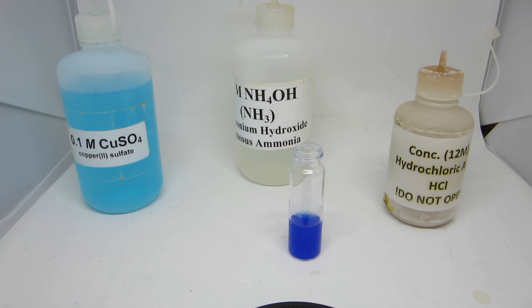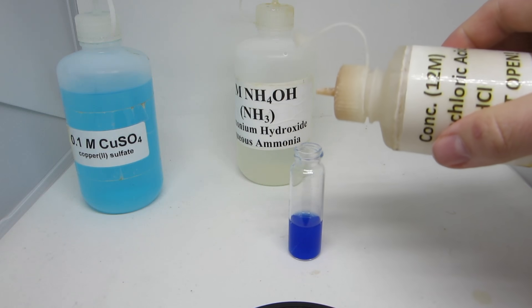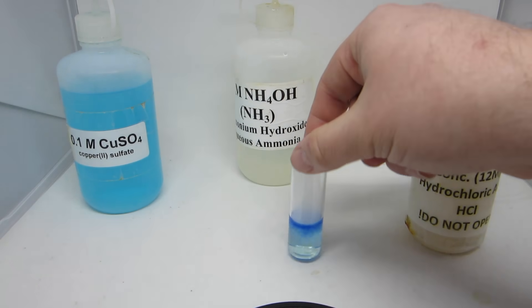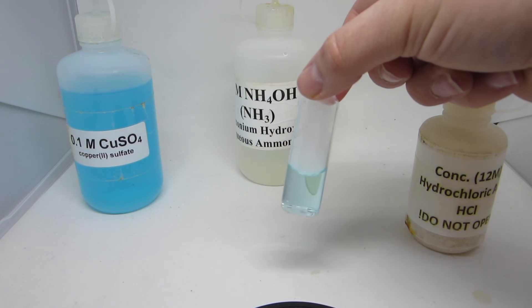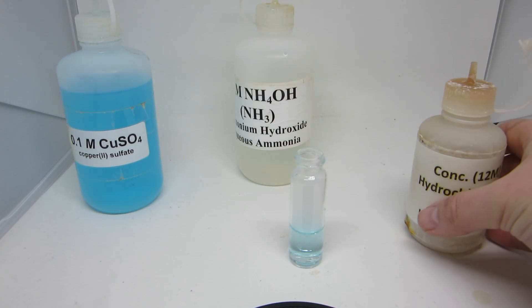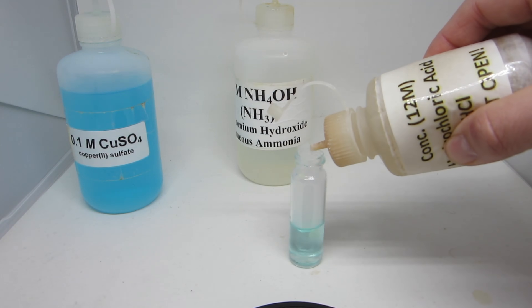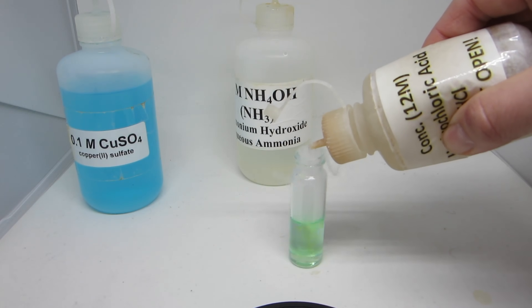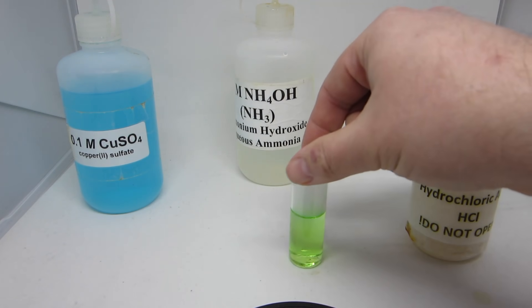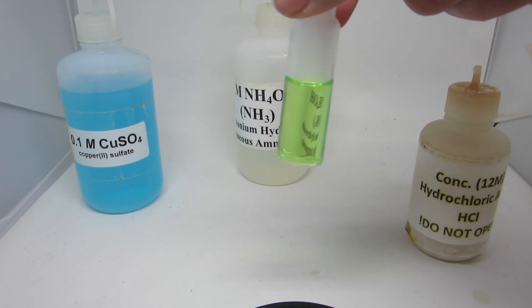This reaction can be reversed by the adding of concentrated hydrochloric acid. A small amount of the hydrochloric acid brings the solution back to a light blue color. Further addition of hydrochloric acid will result in the solution changing from a blue color to a green color, as the chloride ions are displacing everything in the reaction.